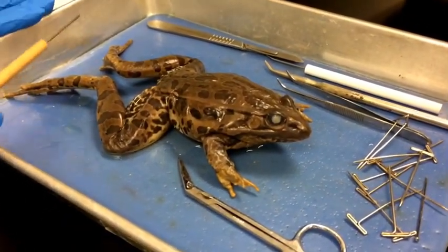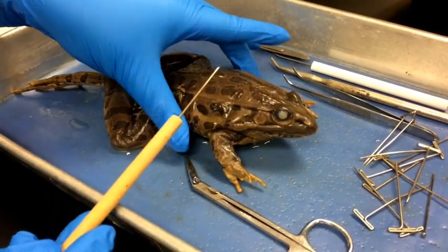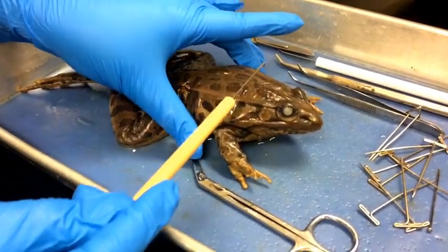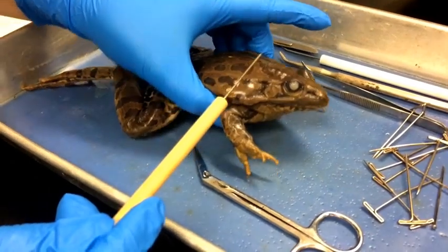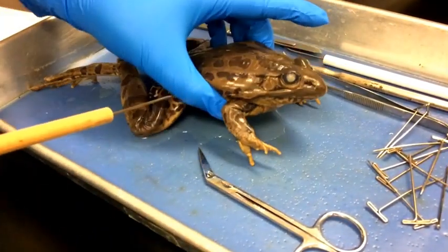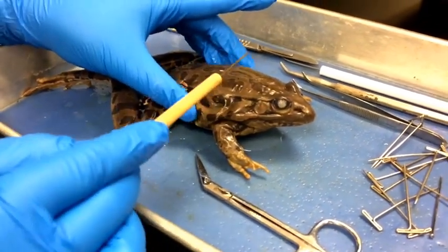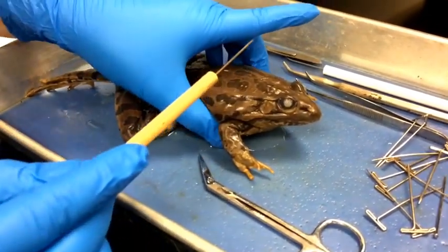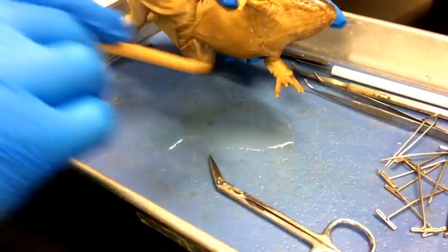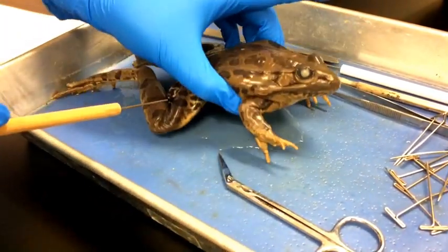Jumping right in, we'll be talking about the skin. On the frog, we have countershading — the top is darker and the bottom side is lighter. This allows the frog, when it's in the water, to not be seen from above, and below it blends in because of the light reflecting off the surface of the water.